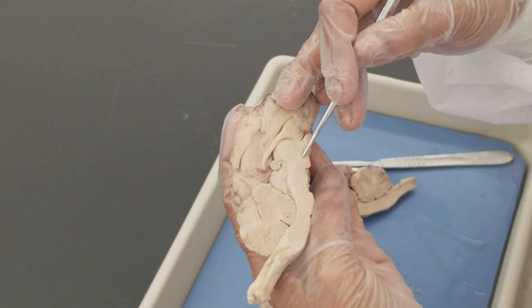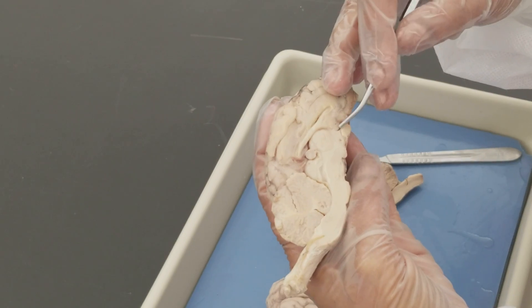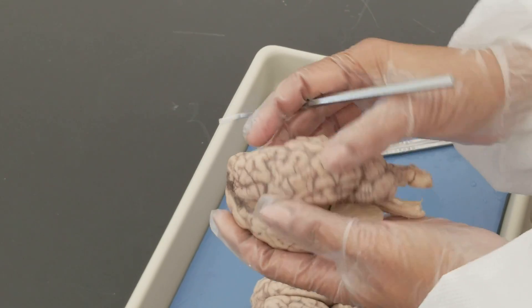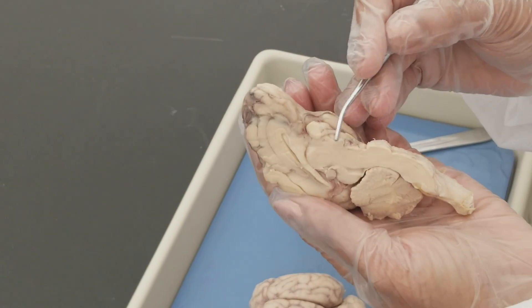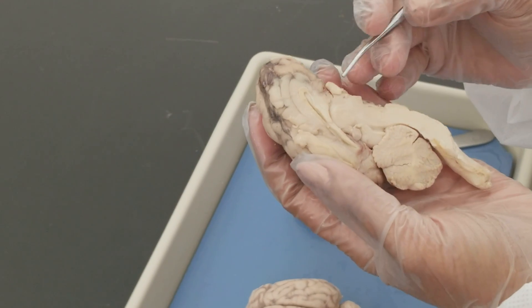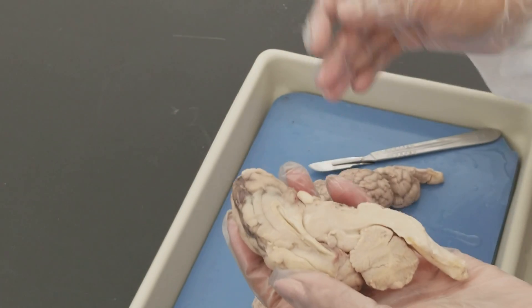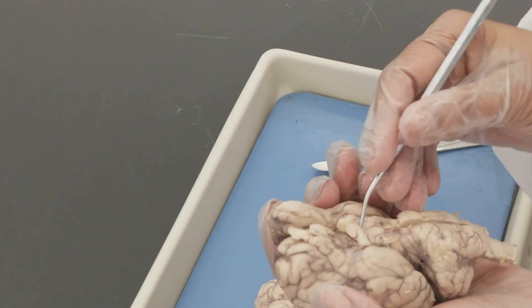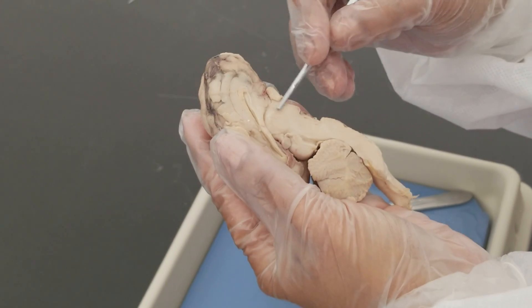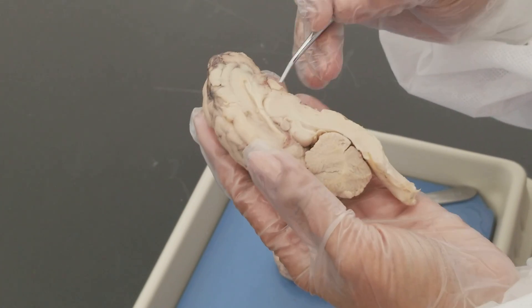Below the thalamus is the hypothalamus, an important autonomic nervous center. You can also identify the optic chiasm here, and the mammillary body — associated with memory and sense of direction. The area between the optic chiasm and the mammillary body is the hypothalamus. If the pituitary gland were still intact, it would be hanging here from the infundibulum. The hypothalamus is the boss's boss — it regulates the pituitary gland, which is the master endocrine gland.